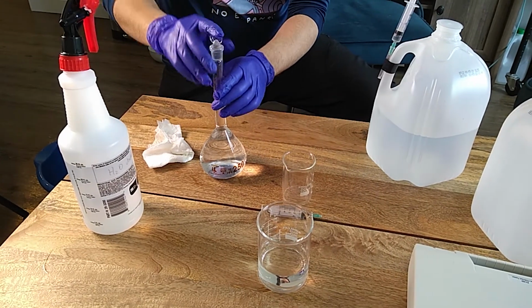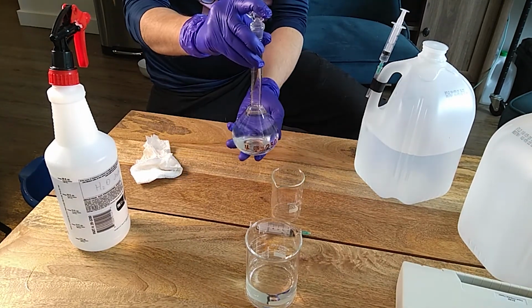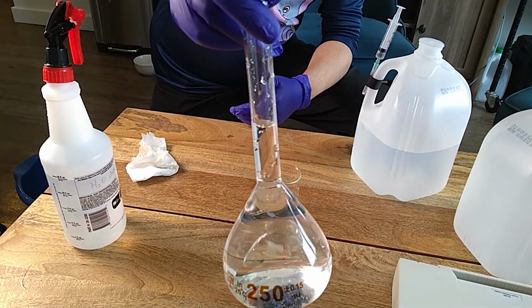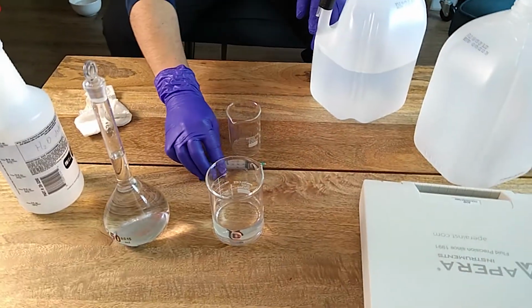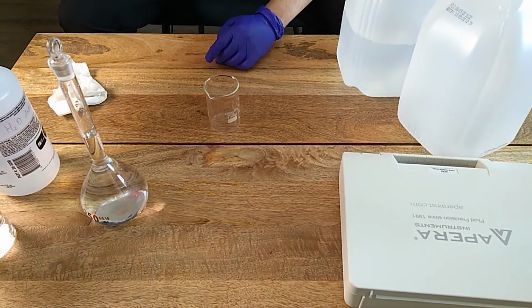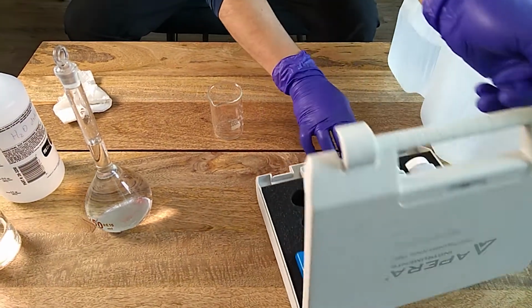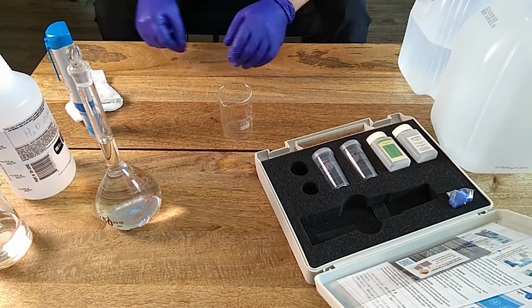And now, as last time, put this in, give it a good shake, and you can see the finally prepared solution here. Okay, so now we've prepared an accurate dilution. And now we need to measure the conductivity of this. So I have this conductimeter that has been previously calibrated.